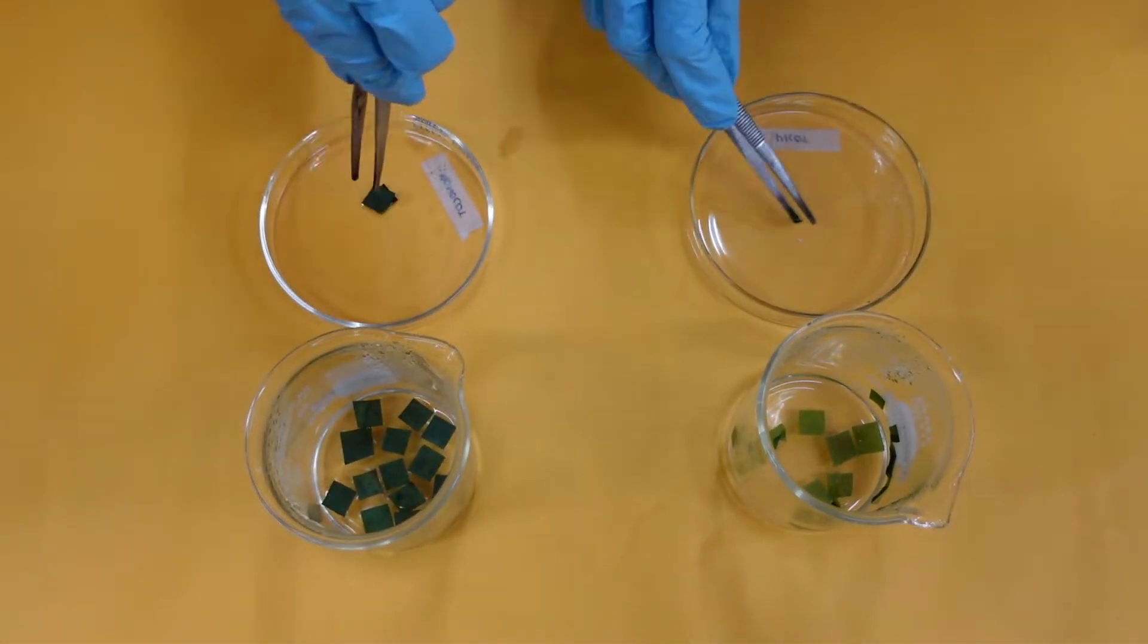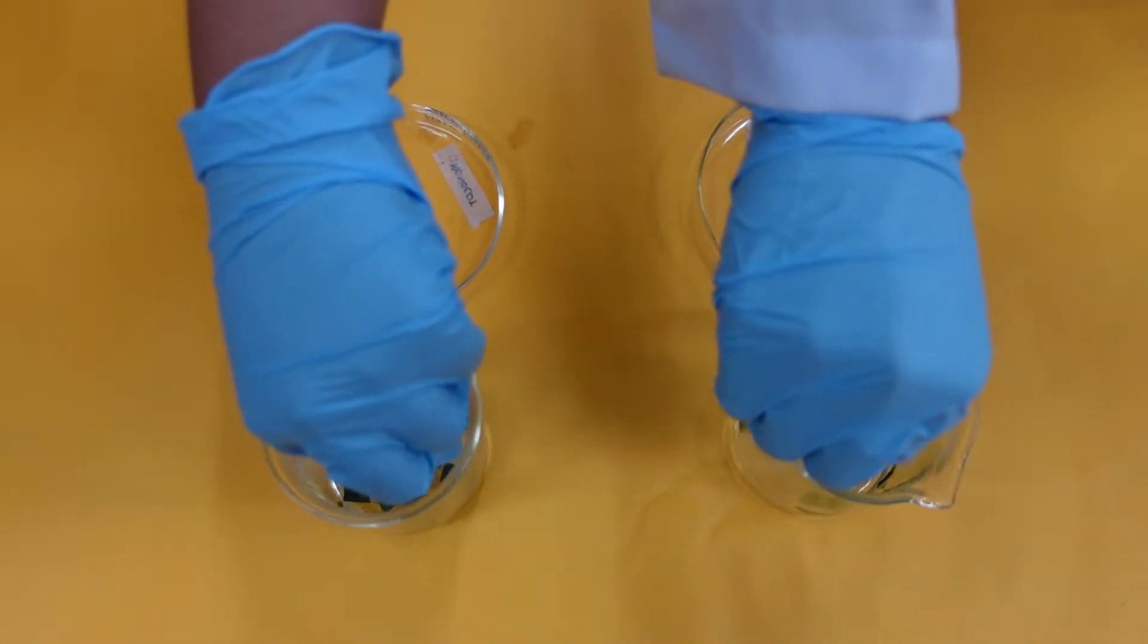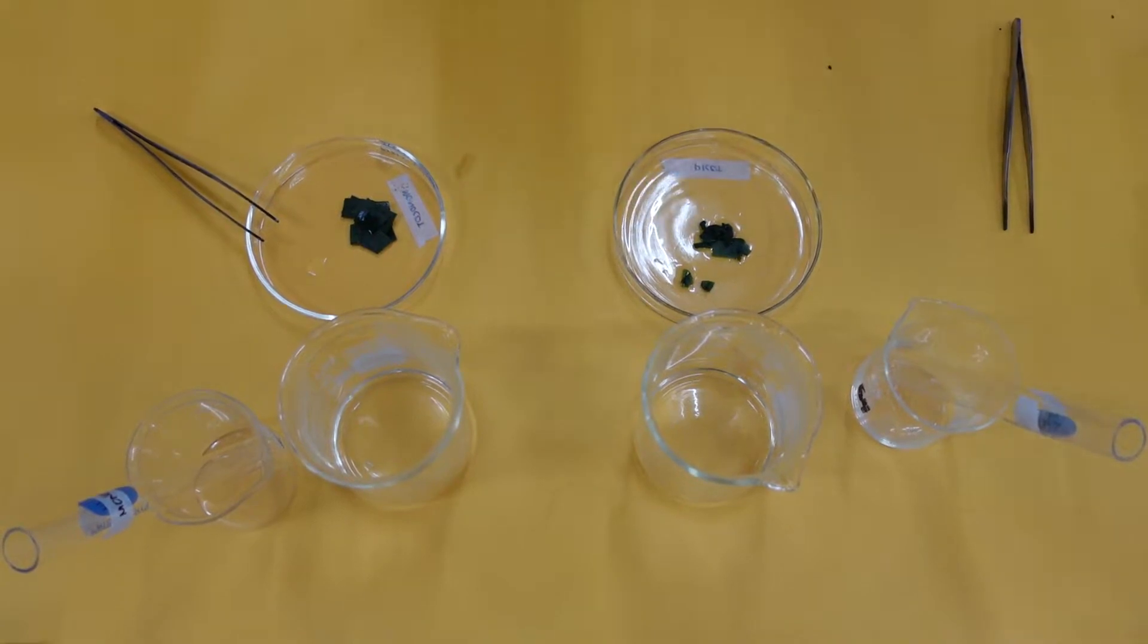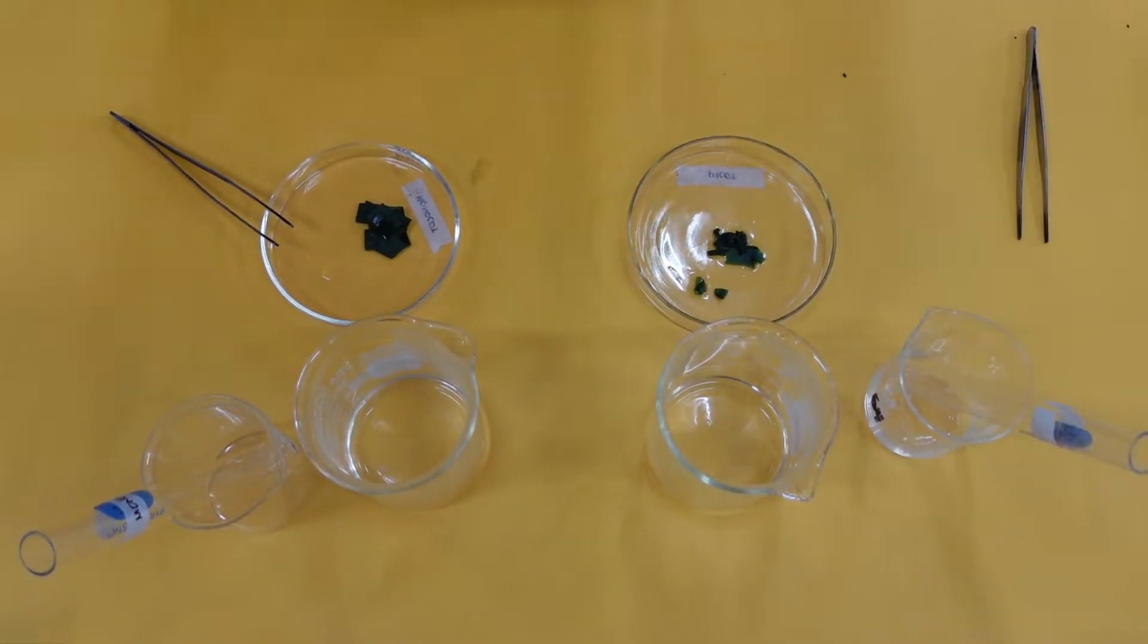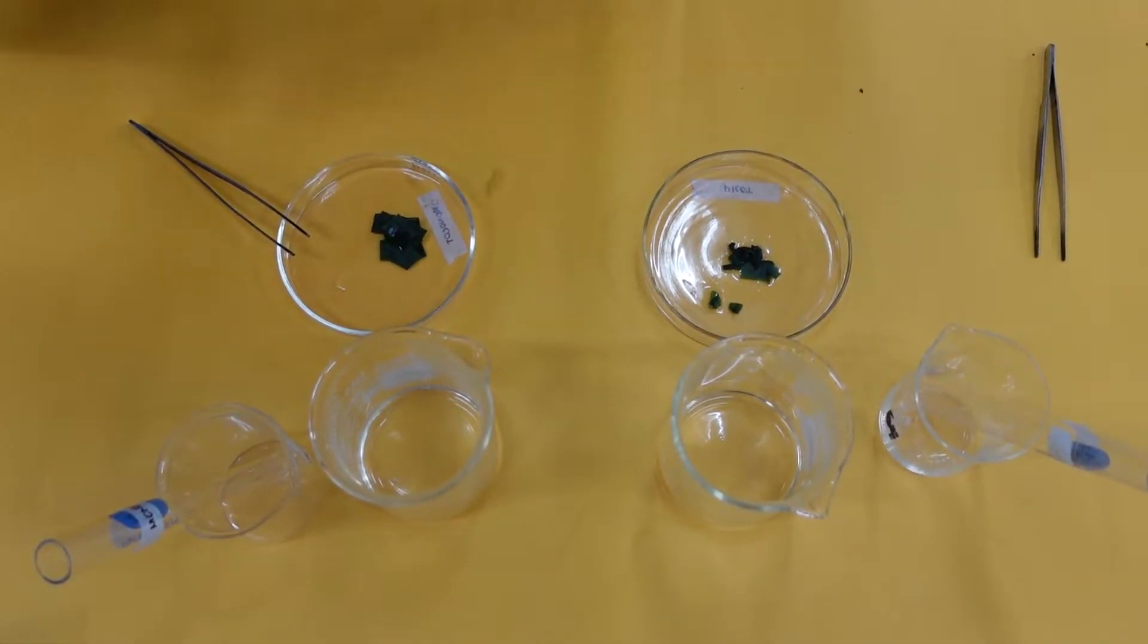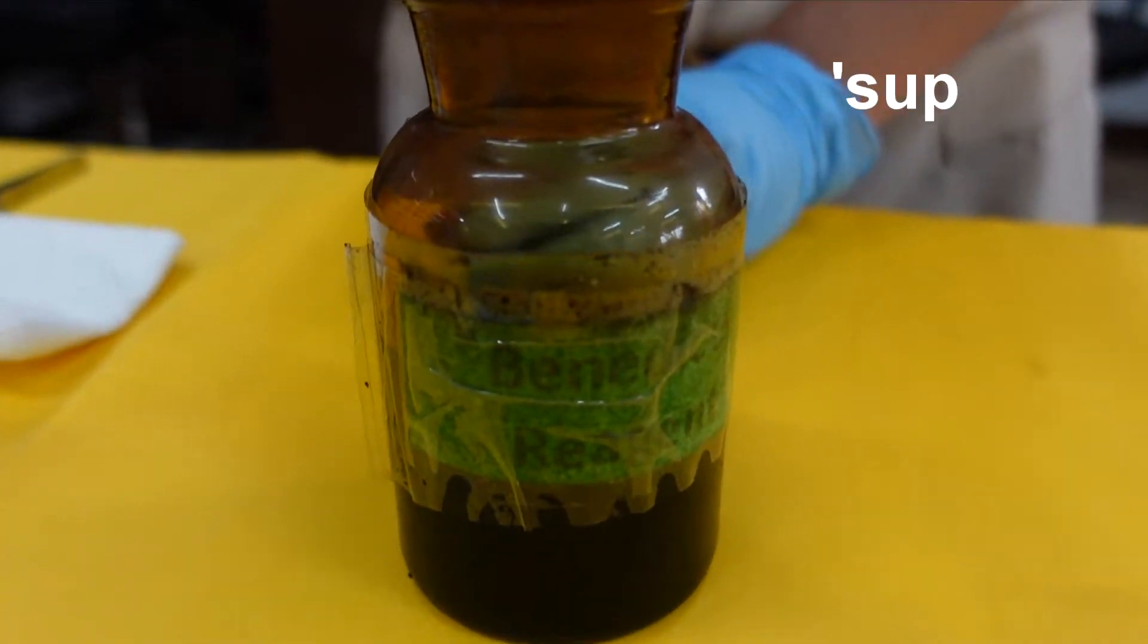Take the boiled leaves and set them aside. We will now use the extract for the Benedict's test.